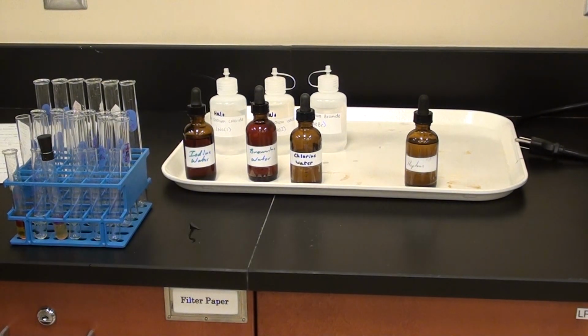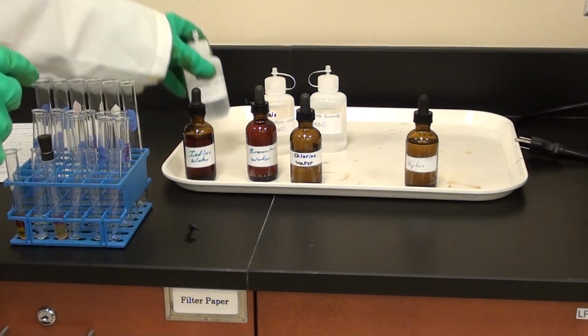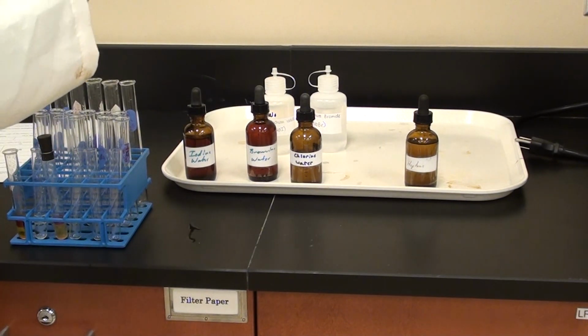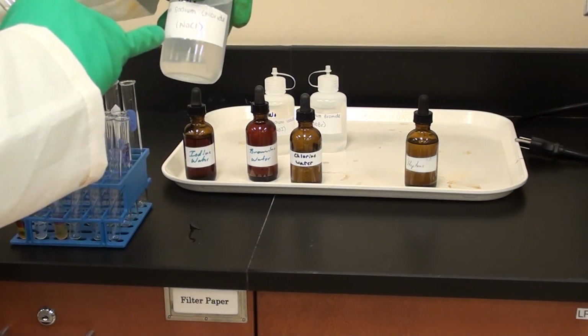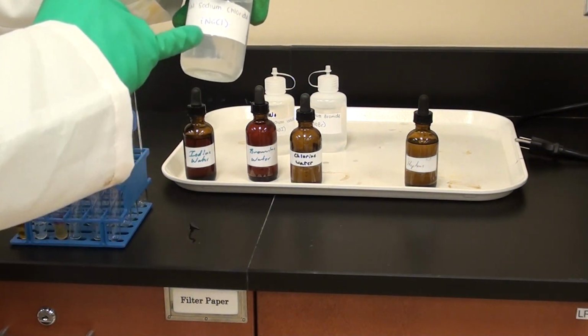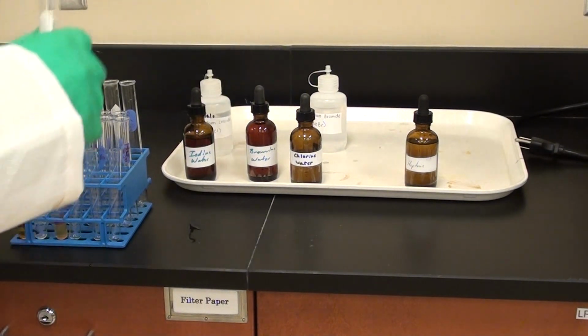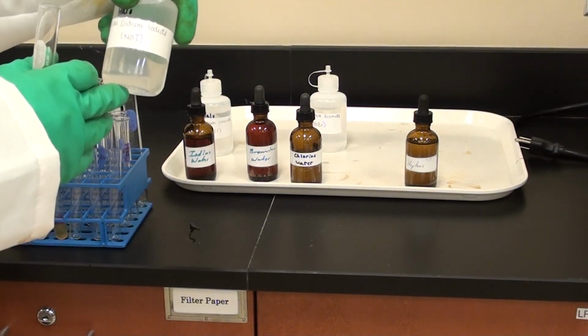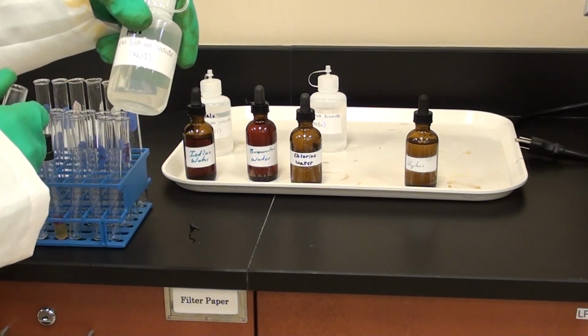So now Jim's going to go ahead and he's going to put some stuff together here. Okay. So now if you notice at the back here, I have sodium chloride. Now that's going to be my source of Cl negative. Again, just like in part 1, the bottles are going to be labeled the actual compound. It will not just say Cl minus. It's really important to not mix up Cl minus with chlorine water. Chlorine water is Cl2, NaCl is Cl minus.